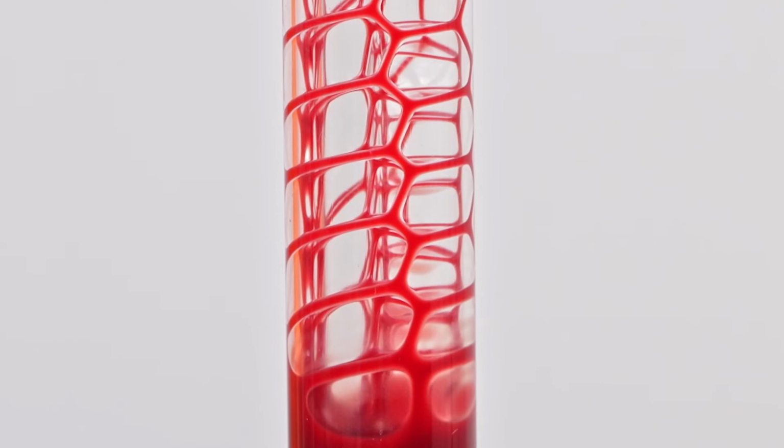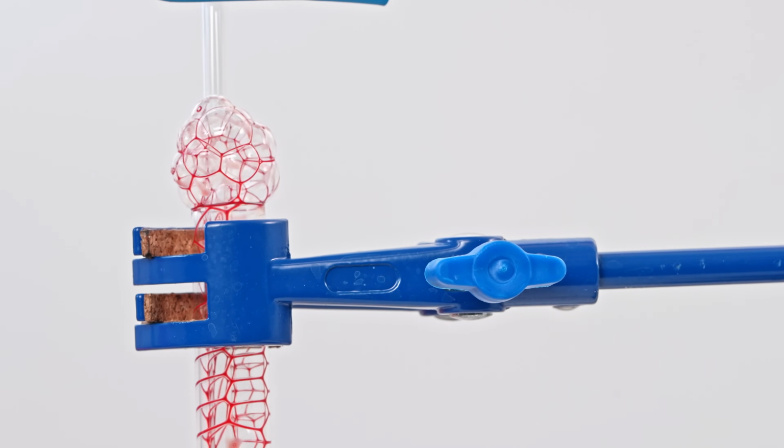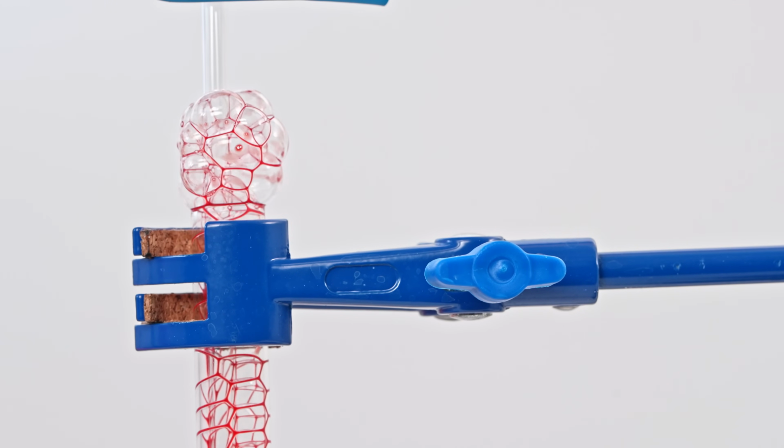Interestingly, we can notice a distinct hexagonal structure forming in the test tube during gas bubbling. I tested it behaves the same way with inert gas too, so it's not about the gas itself. As the gas flows, hexagonal structures create a large soap-like hexagonal bubble at the top of the test tube.